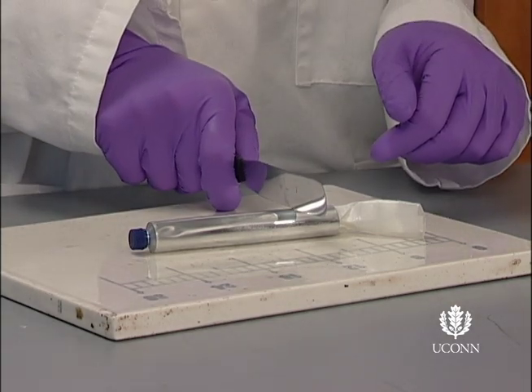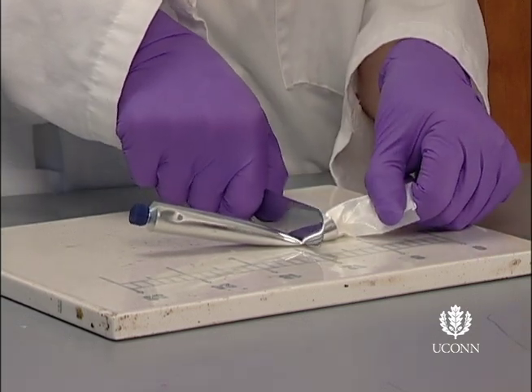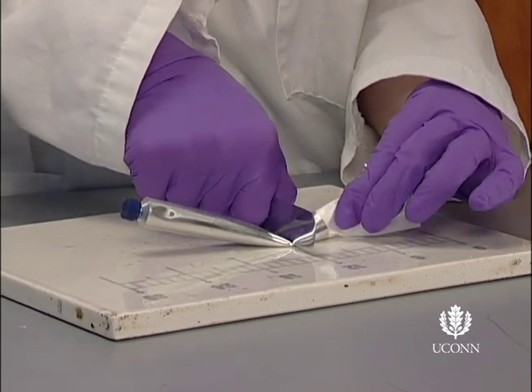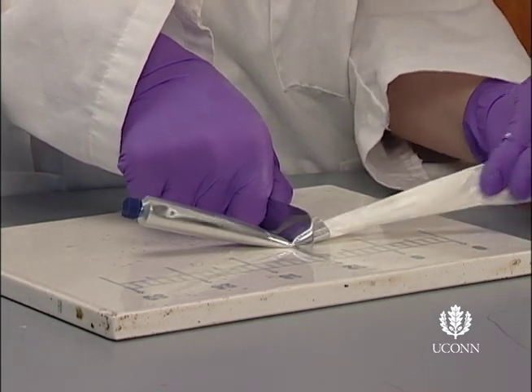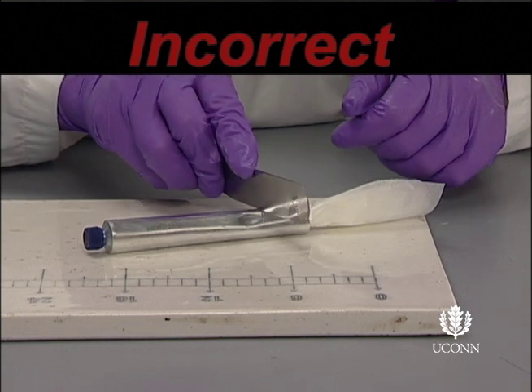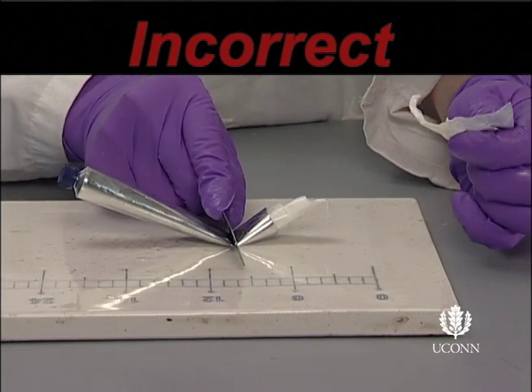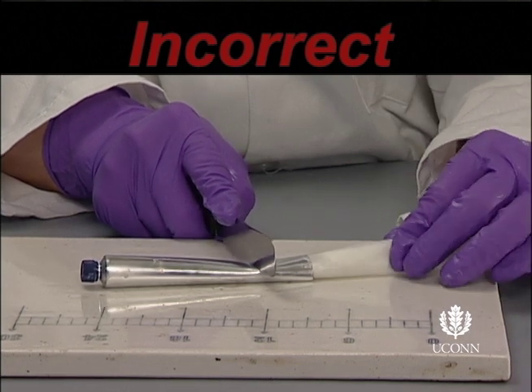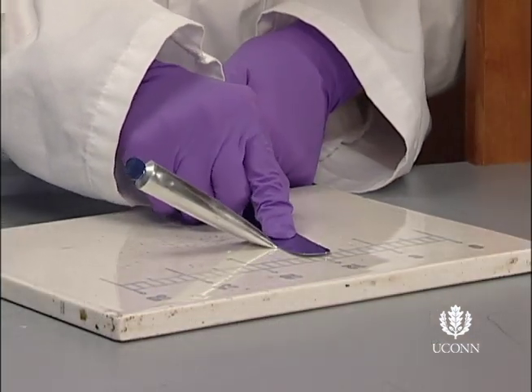Place the edge of your spatula across the tube about 3/4 to 1 inch from the end of the tube and gently press down. While applying downward pressure on the edge of the spatula, pull the paper from the tube. Pressing too hard will cause the paper to break. Pressing too gently will allow the ointment to come out of the tube with the paper. You are now ready to fold the end of the ointment tube.